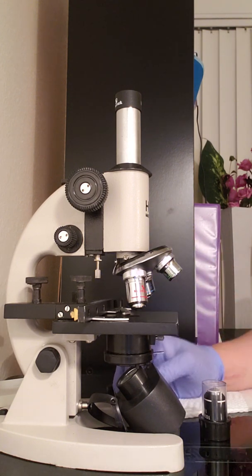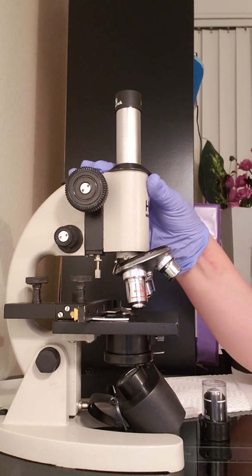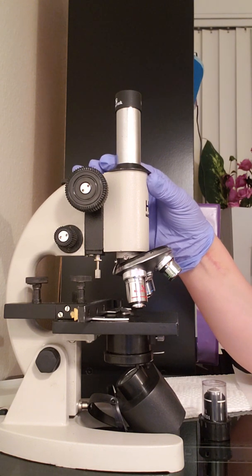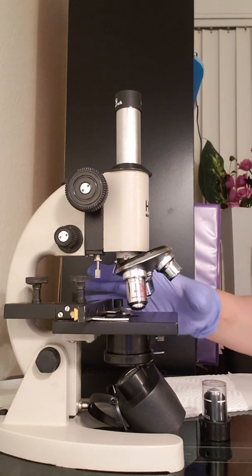Okay, now to get started, first I'm going to describe the field of view, and that is an area that is being observed. So you're able to see just the image itself through the microscope. And the depth of field is the distance range in focus at a time, which emphasizes the area of more of the background. So you're going to see everything.